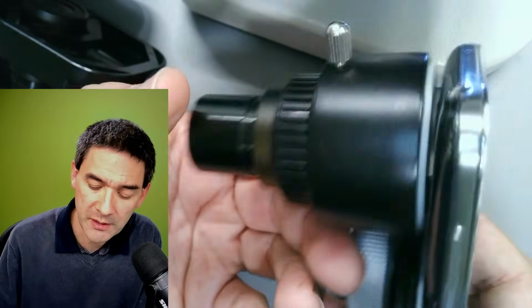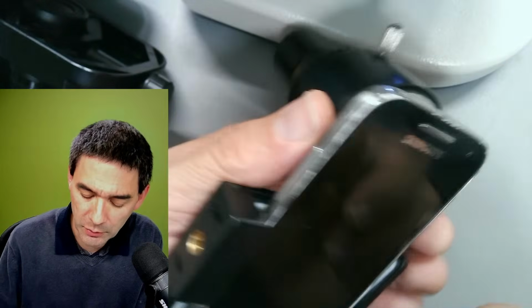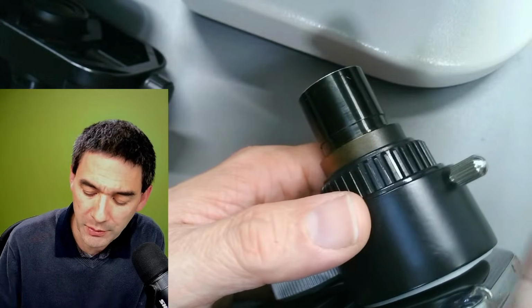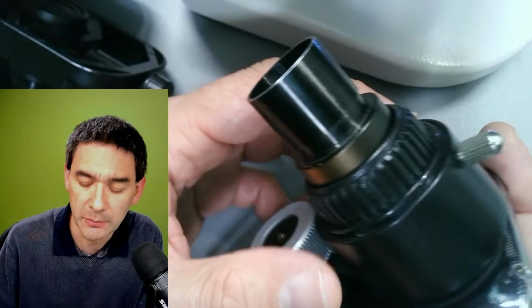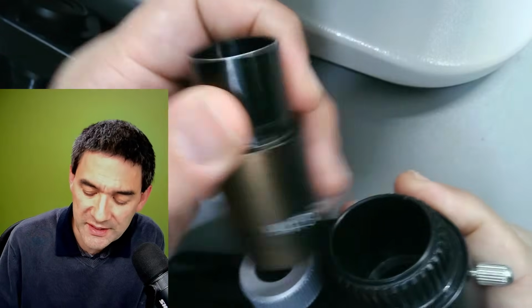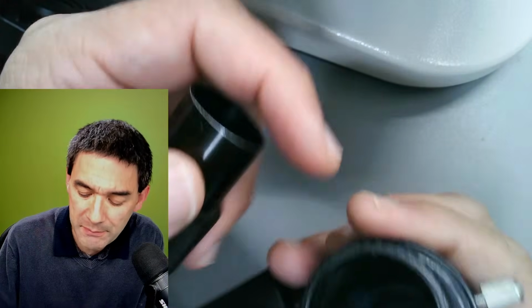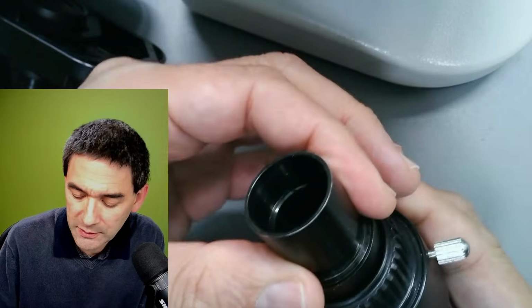But otherwise, I'm quite happy with this one generally. I don't know, honestly, you'd have to check a little bit. I bought it several years ago, so I'm not quite sure whether they are still available or not. But I do remember darkly that this model came with two different sizes of eyepieces, and I got the one that actually fits this one over here. So that's also something.